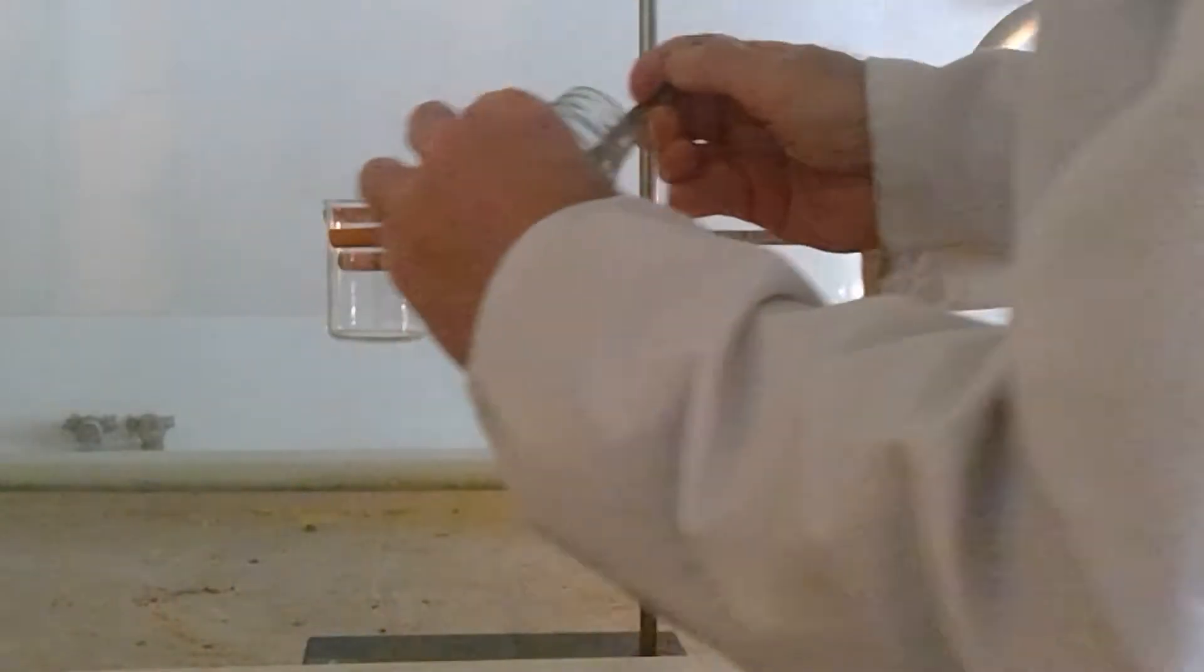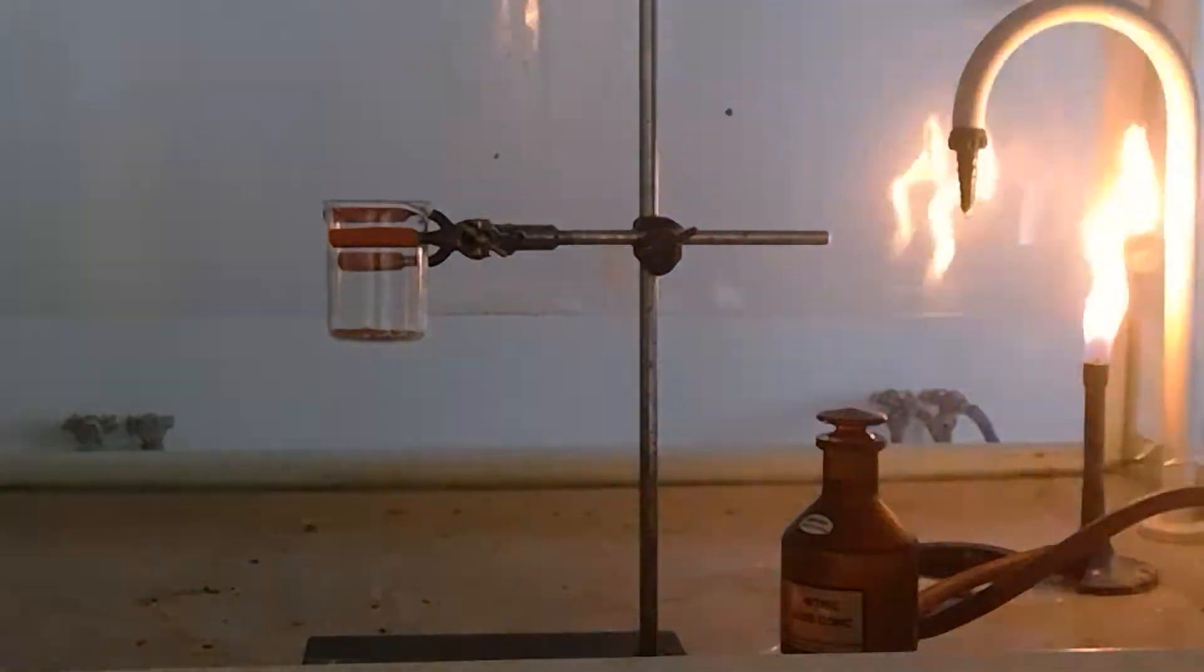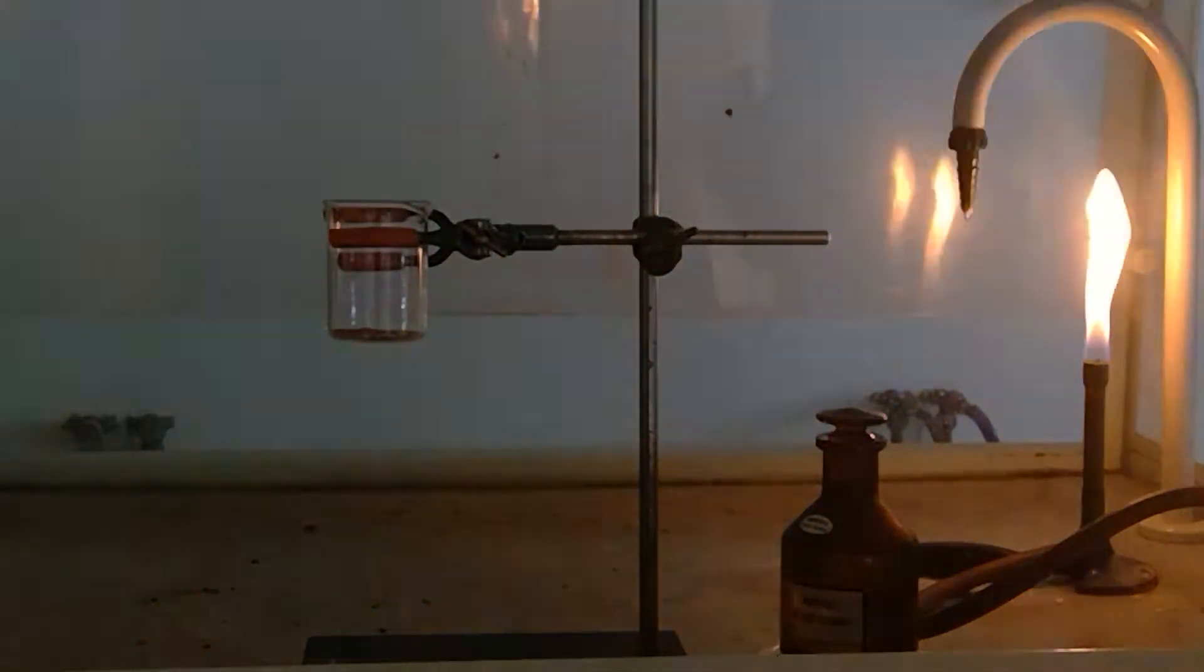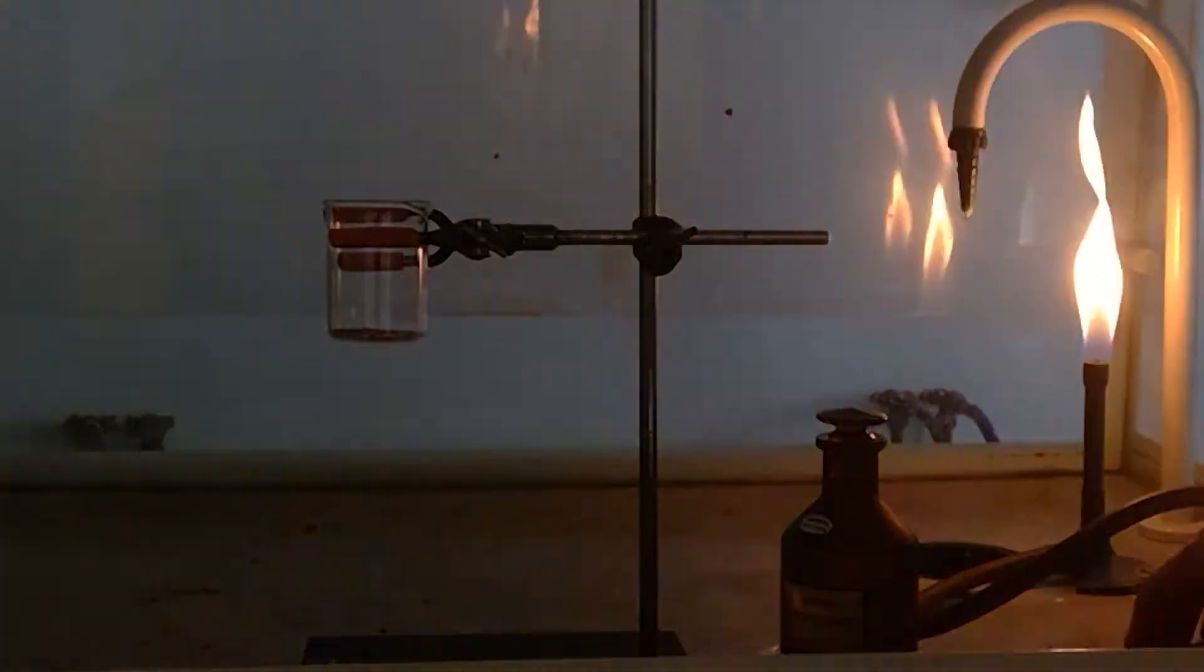I'm going to add some copper to this small beaker and then add sufficient concentrated nitric acid that all of the copper ultimately will dissolve.